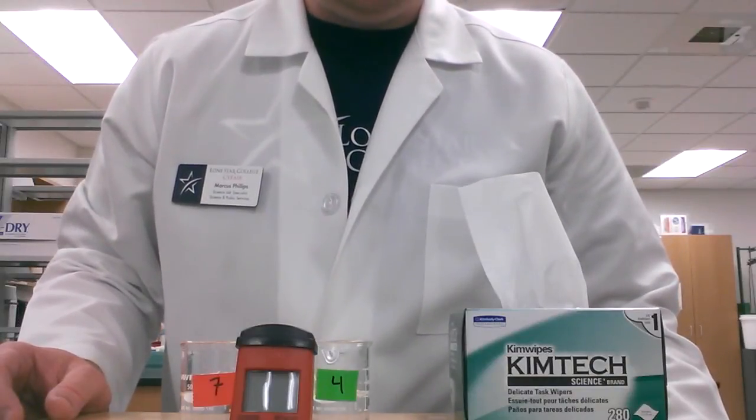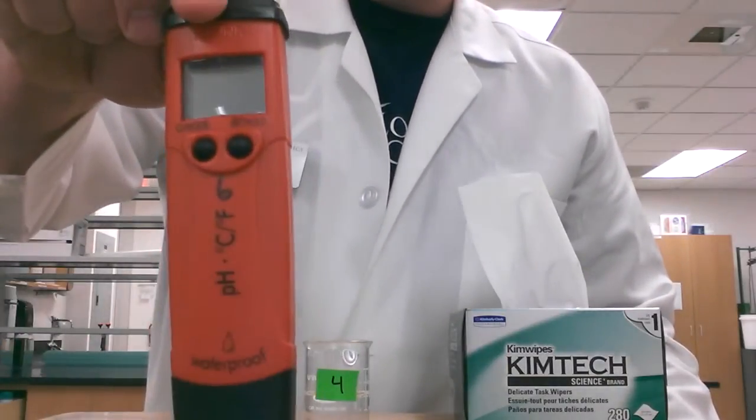In this video, we're going to go over how we calibrate this handheld pH meter.